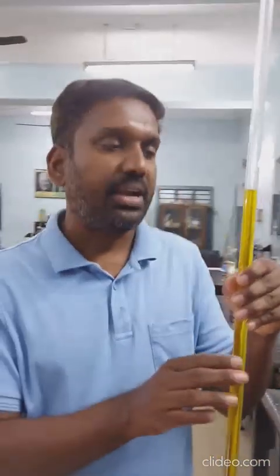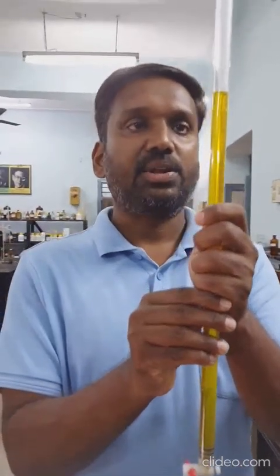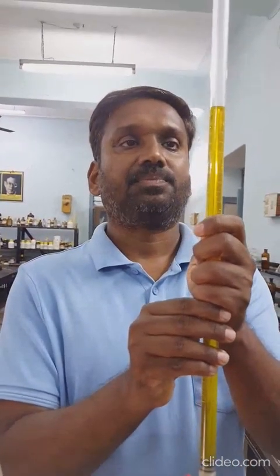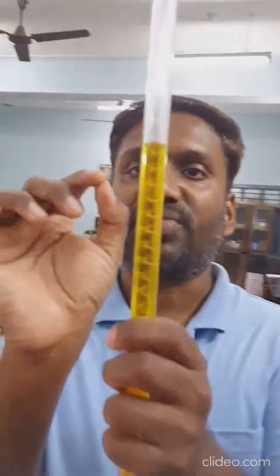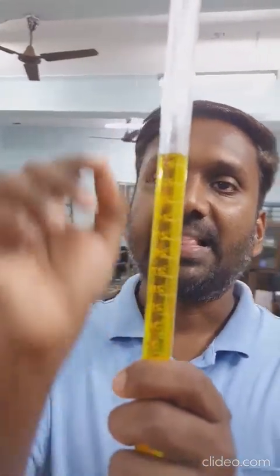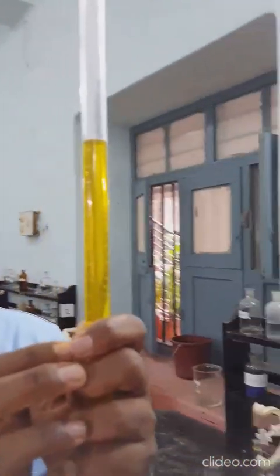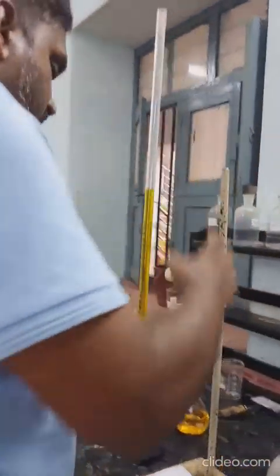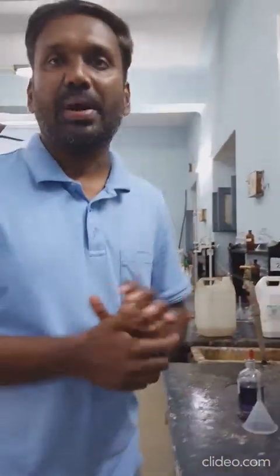To take the final burette reading, remove the burette from the stand and then bring it again to your eye level. In this case it is 20.5. Again, the lower meniscus is our reference - 20.5. Once you do this, your first trial is over.